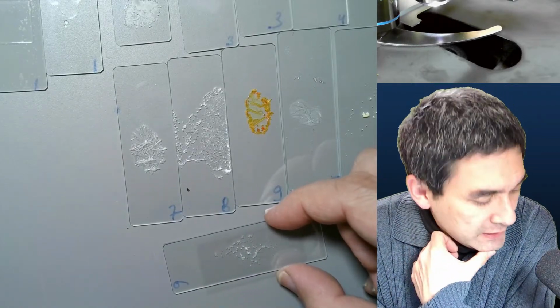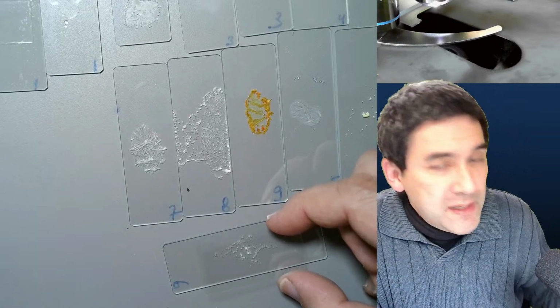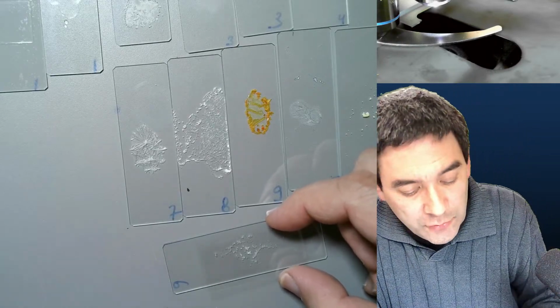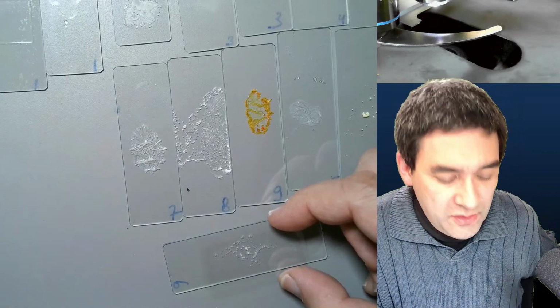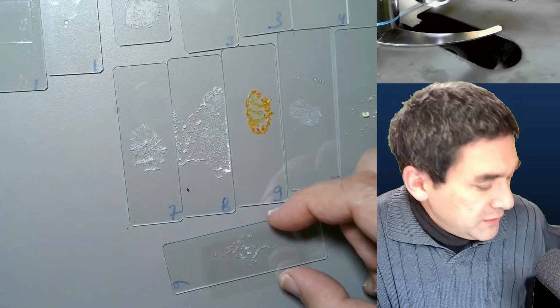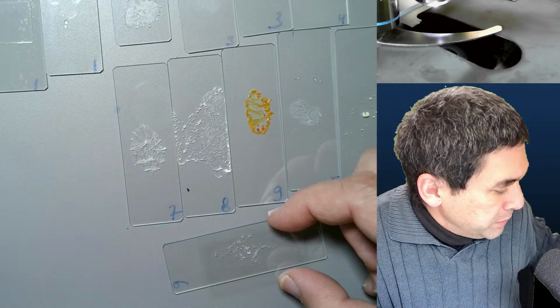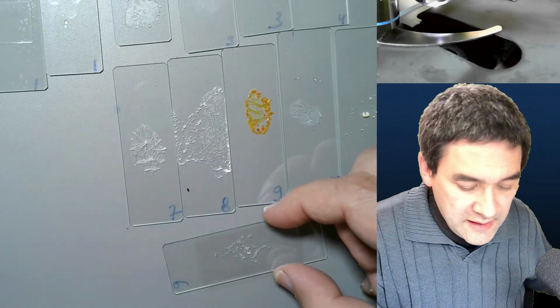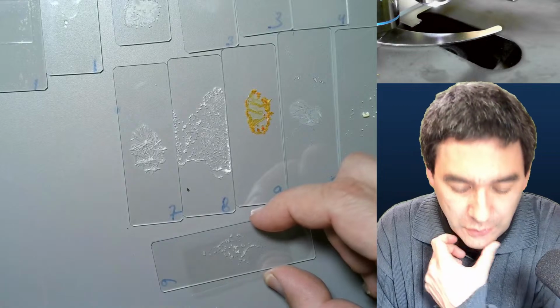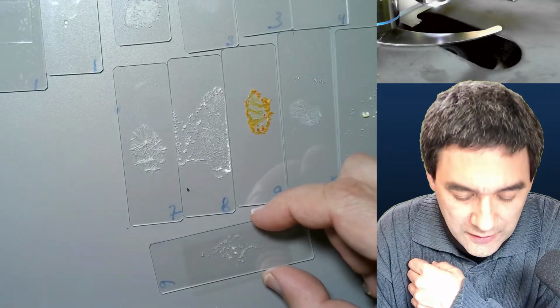And I found something, and I'm not saying that this is the best solution. I'm not saying that I recommend it or that I'm not recommending it. We're just going to experiment with this, okay? And then you can try it yourself, and you can decide yourself whether this is something meaningful or not. I just want to demonstrate this.